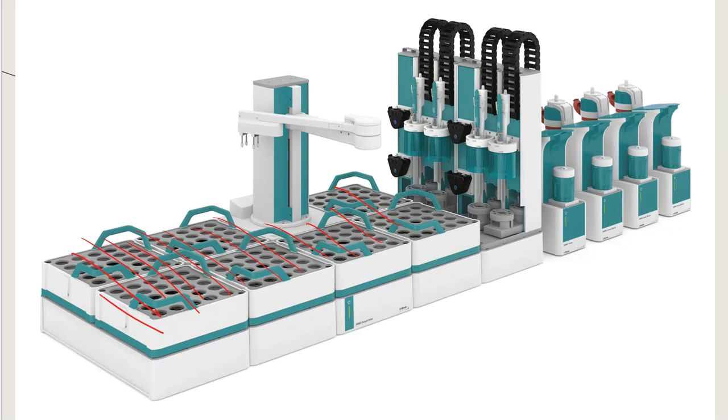You can also put different dosing units onto the instrument as well. So you can dedicate one burette with sodium hydroxide, one burette with maybe hydrochloric acid, one burette with potassium hydroxide. I mean, who knows? But you can have different dosing devices, and those different dosing devices are like different burettes, and those stay ready to go, and you can pick which one you want to use depending on what you need to titrate throughout the course of a work day. So just keep that in mind.